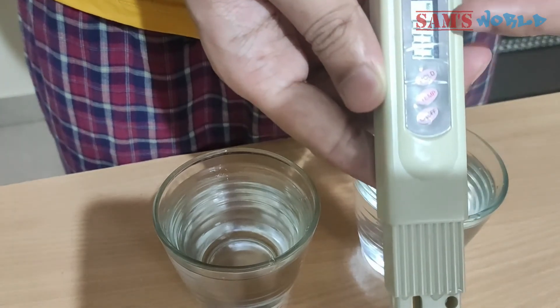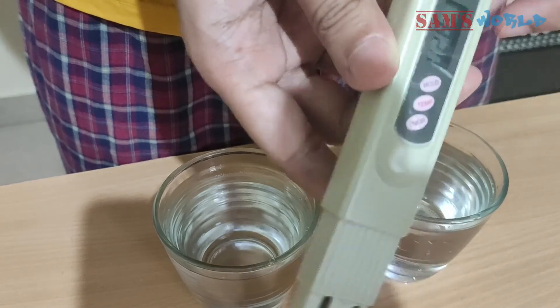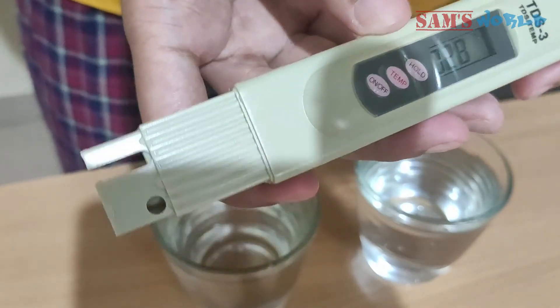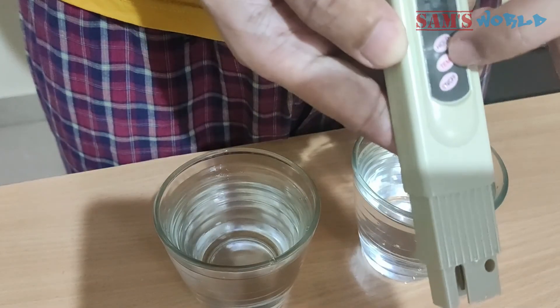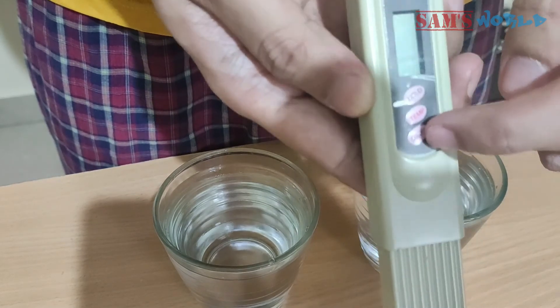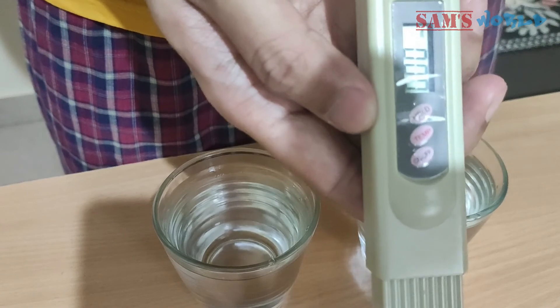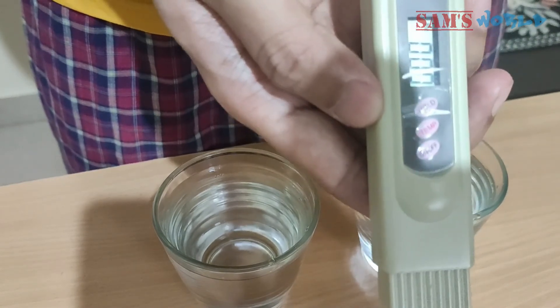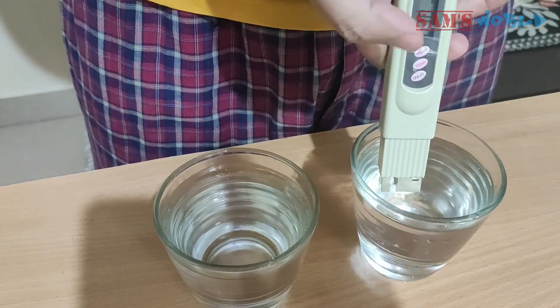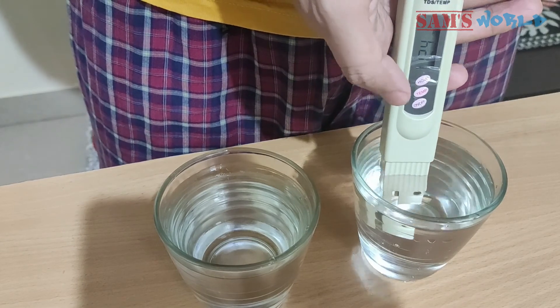I will first turn on the TDS meter — you can see the readings are zero. If I press the temperature button, you can see it gives the temperature of the day; it's 28°C right now in Bangalore. Let me restart the meter and check the TDS level of each water. Let's first test the tap water — you can see the reading is 124.